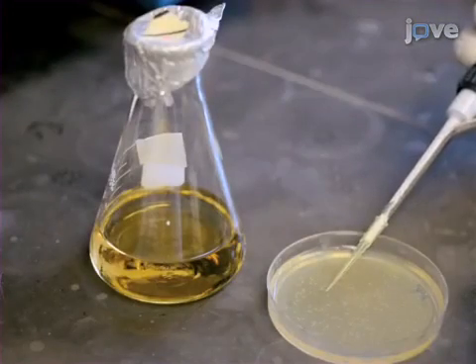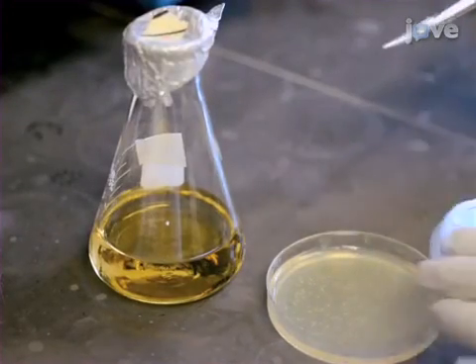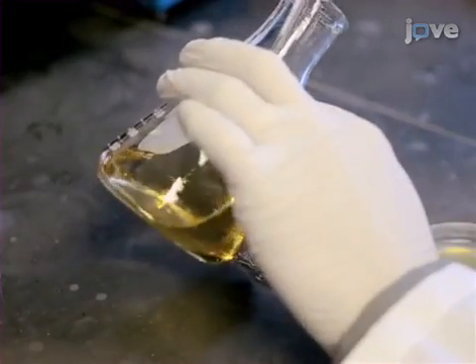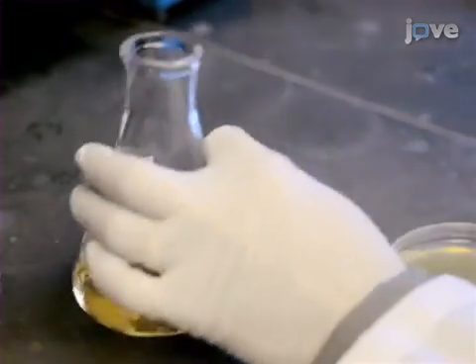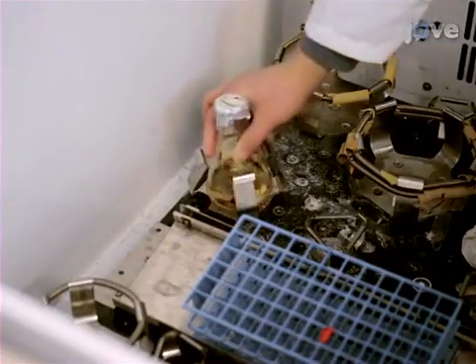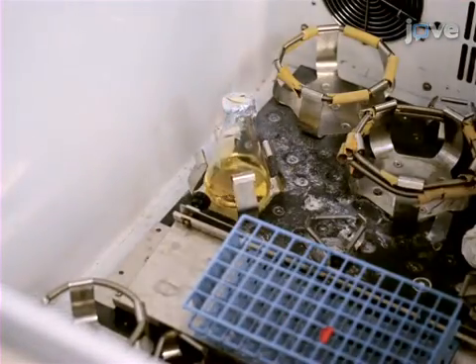Next, pick a colony of OP50 bacteria and transfer it to a 50ml bottle of LB. Culture the bacteria overnight at 37 degrees Celsius with shaking at 220 RPM.